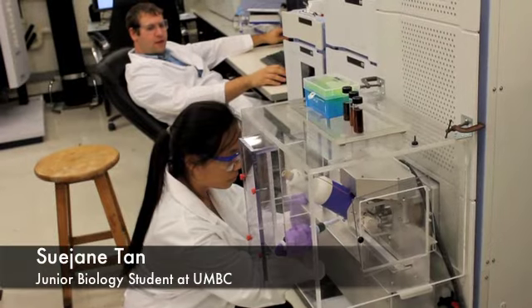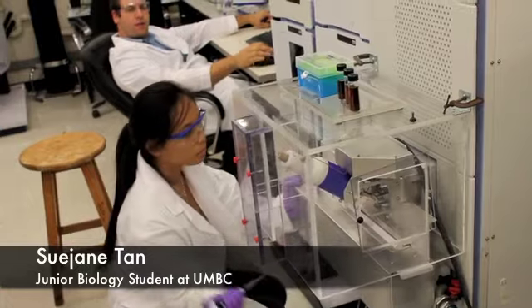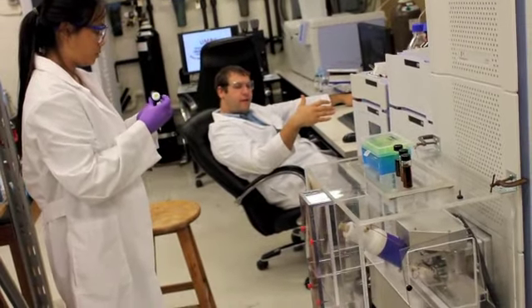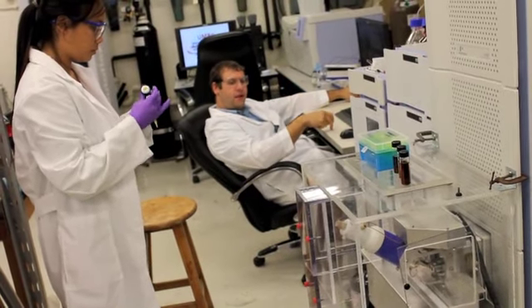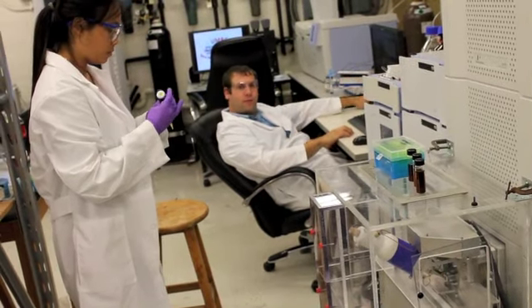She is picking up 10 microliters of the sample and placing it onto a screen. The screen holds the liquid there. And then we'll take the screen and put it in front of the ion current, and then the ions will hit the sample. Once they hit the sample, they'll get charged themselves and then run into the mass spectrometer.